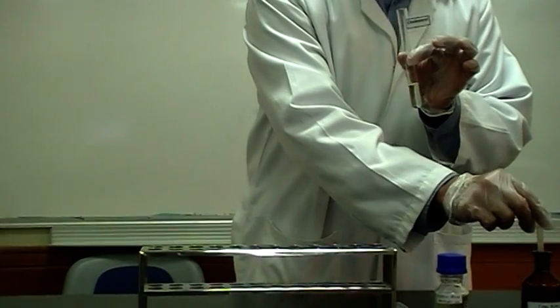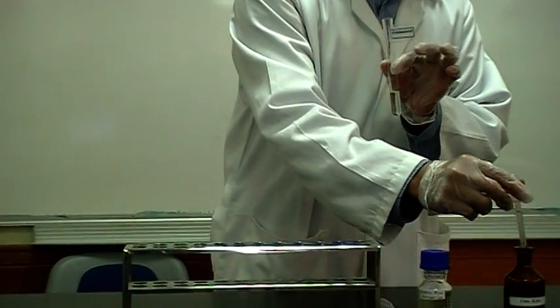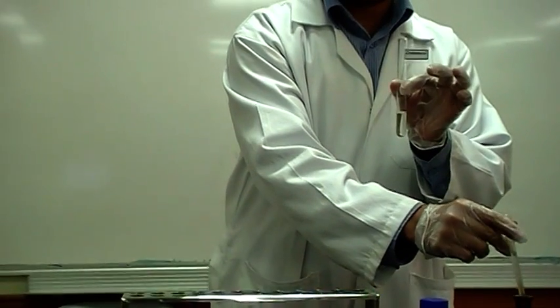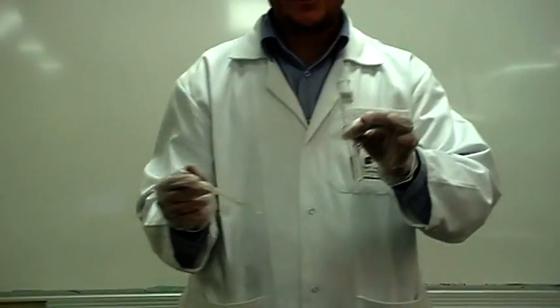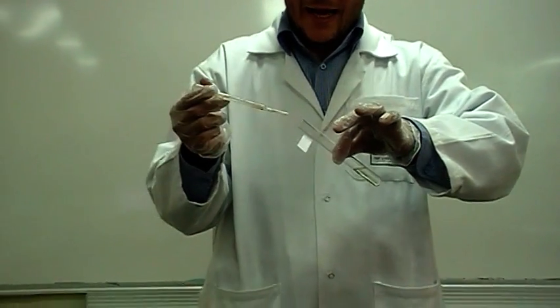Then be careful about this step. Adding a few drops of concentrated sulfuric acid. You need to tilt this tube and add sulfuric acid.